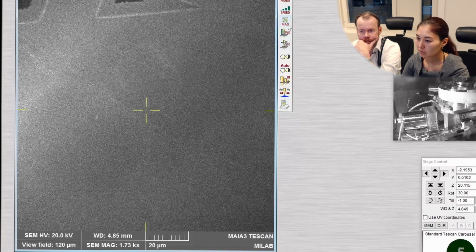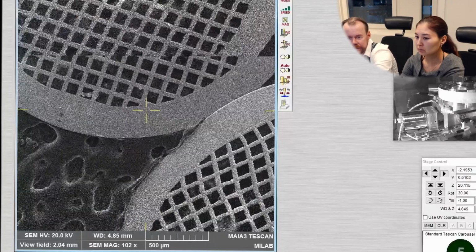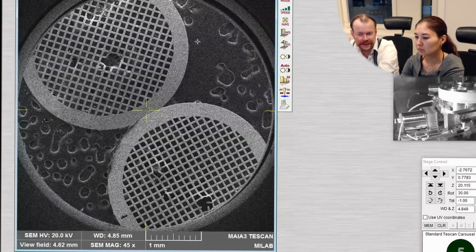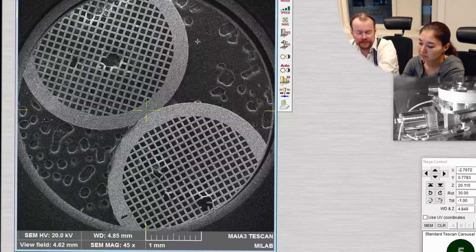So what do we have here? The whole grid here. So what have we been doing here now? We basically have 2 grids there. And we can see that one grid is a little bit brighter, another is a little bit darker, barely noticeable. And the reason for that is that I have taken 2 TEM grids and put colloidal gold particles on them, on the top side, on the carbon coating. And then by intention, I flipped one upside down. And the reason for that is then the particles will be underneath the carbon coating on one of them.